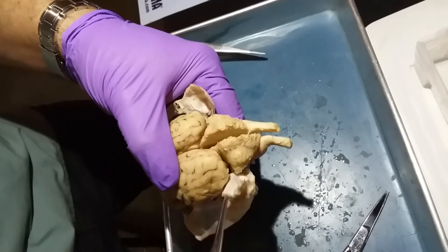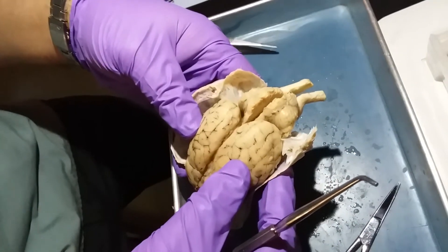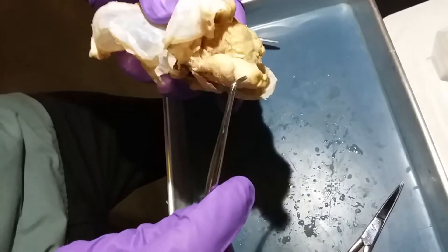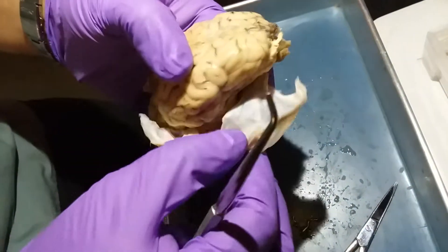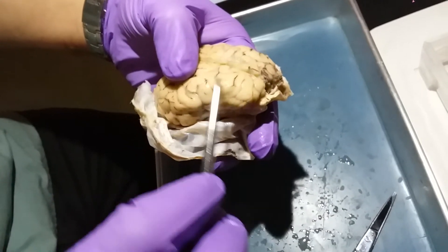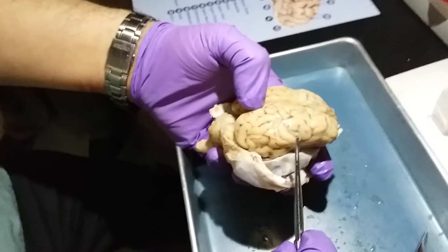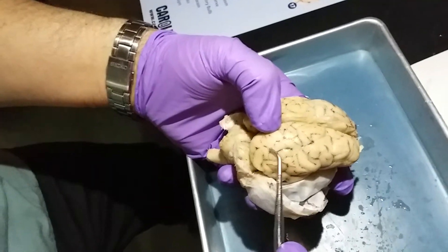Number three is the spinal cord, located right over here — that's where it starts. The frontal lobe is located in the front, conveniently enough — right in here. The parietal lobe is behind it, and in humans there is a central sulcus that basically divides the frontal lobe from the parietal lobe.